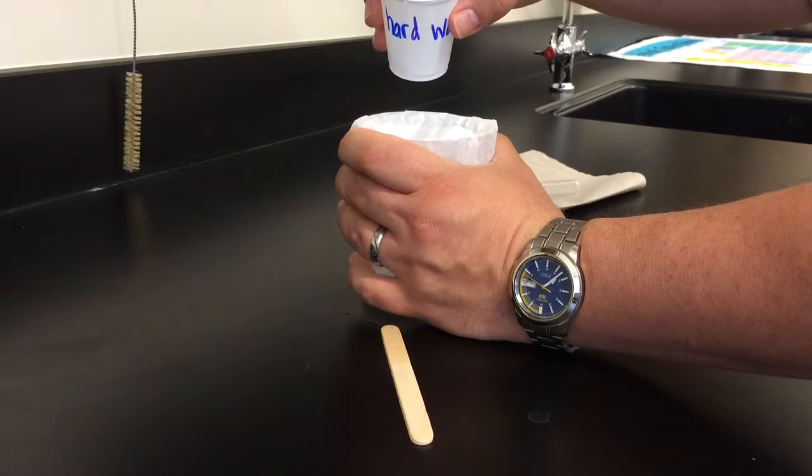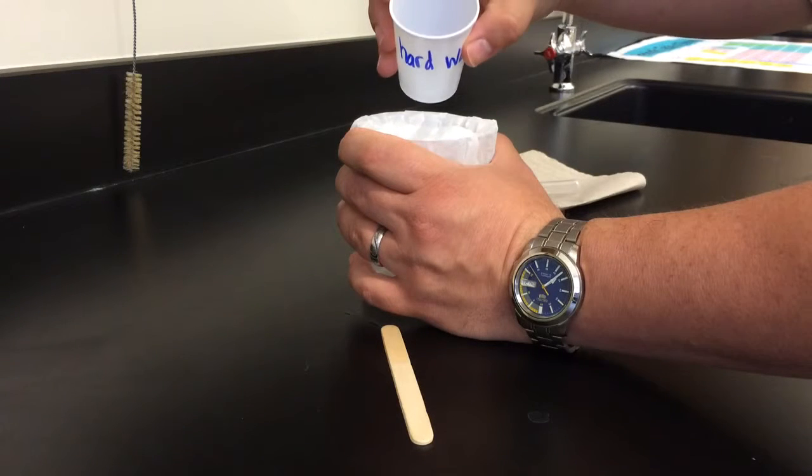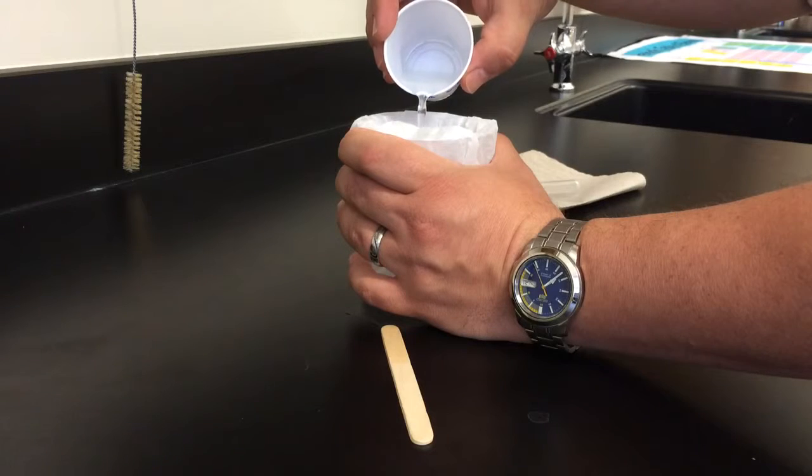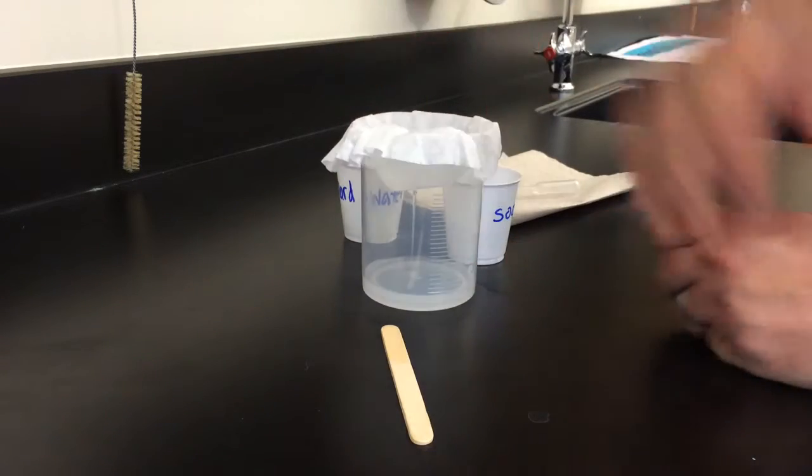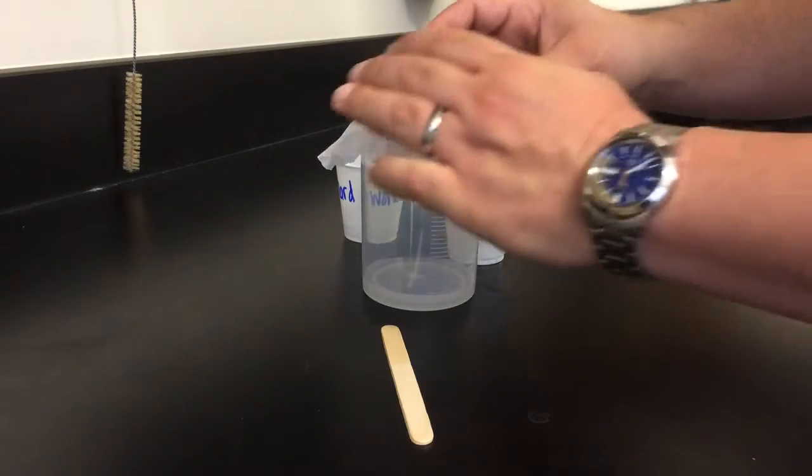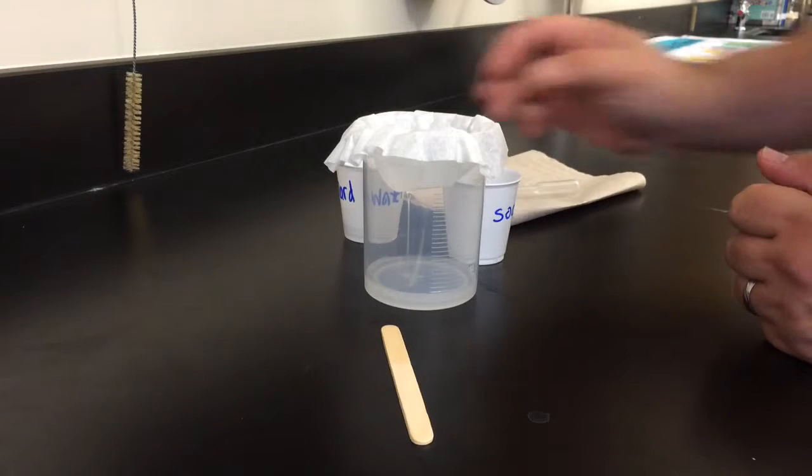Add that slowly and let it drip through, give it some time. It will drain through the coffee filter and when it comes out the bottom of the coffee filter will be just liquid. What we're trying to catch is the solid that will be on the coffee filter.